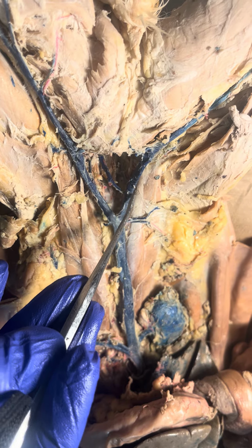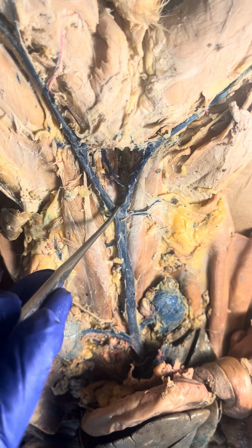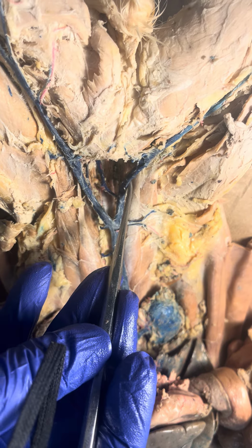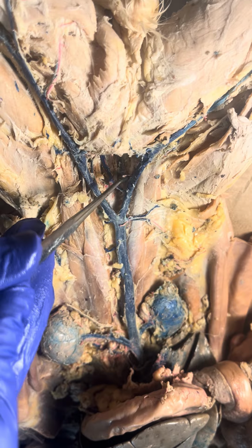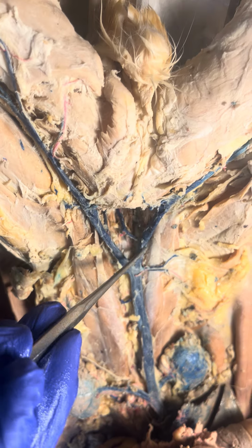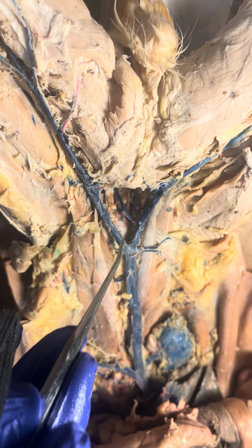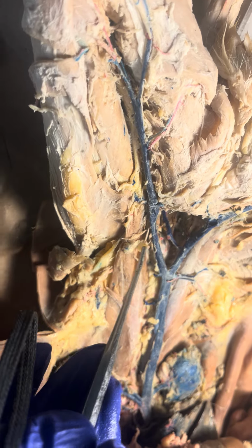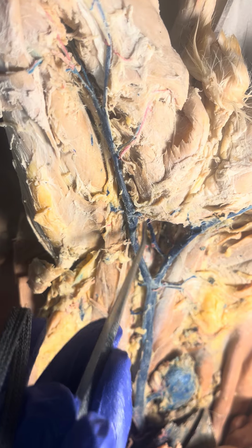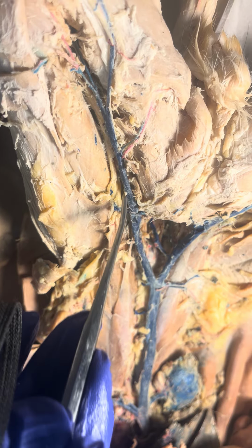So the common iliac, right, this inferior vena cava splits into the two common iliacs, and then the internal iliac comes off, and now the vein is called the external iliac. Okay? Then this is the external iliac. So it's the common iliac, and then the internal iliac comes off, and then it's the external iliac. And now I see it better here on the left side. So again, I see the common iliac and the internal. I don't see it as well here. This looks like it. And then the external iliac.